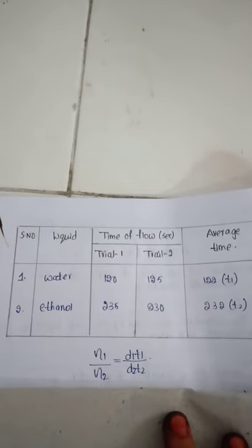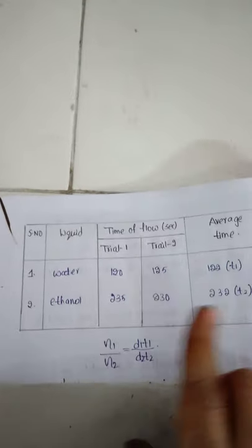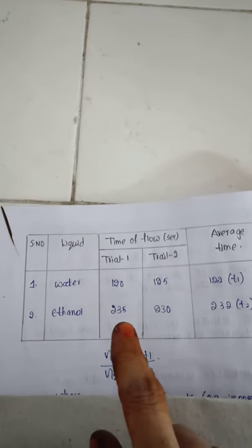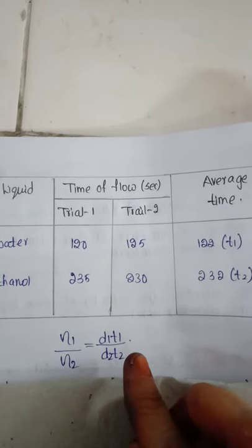Now for the calculation part, we note the values in a table with columns: serial number, liquid, time of flow, and average. For water: trial 1 is 120 seconds, trial 2 is 125 seconds, average time is 122 seconds. For ethanol: trial 1 is 235 seconds, trial 2 is 230 seconds, average is 232 seconds, considered as t2. The formula to calculate the viscosity is: η1 / η2 = d1·t1 / d2·t2.